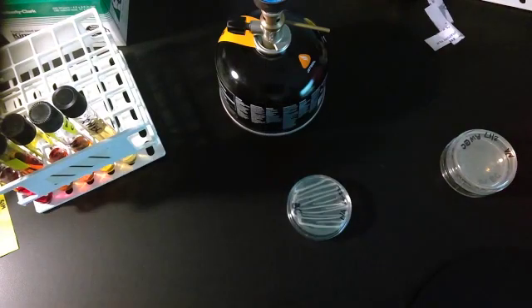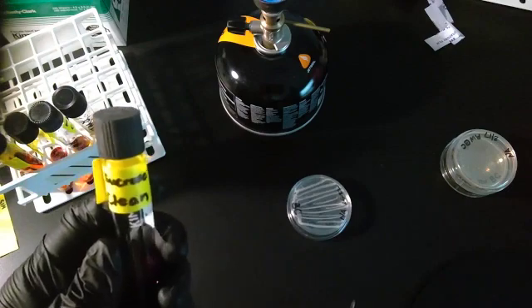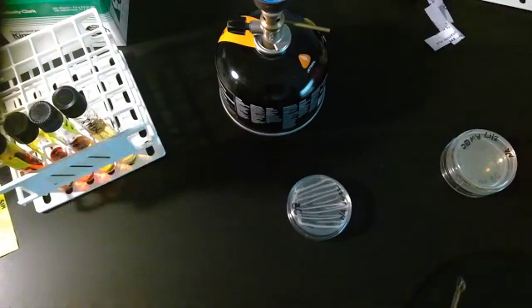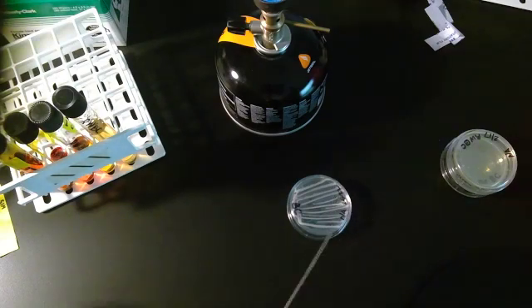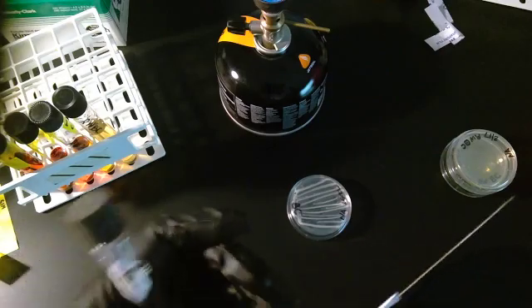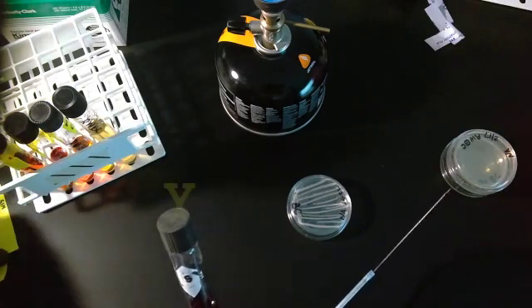Now moving on to our tubes. Here's my sucrose tube. Because I'm about to put this in the fire, I'm going to take this tape off. Now if you're wondering how I keep them straight, these are actually labeled. See the S right there?